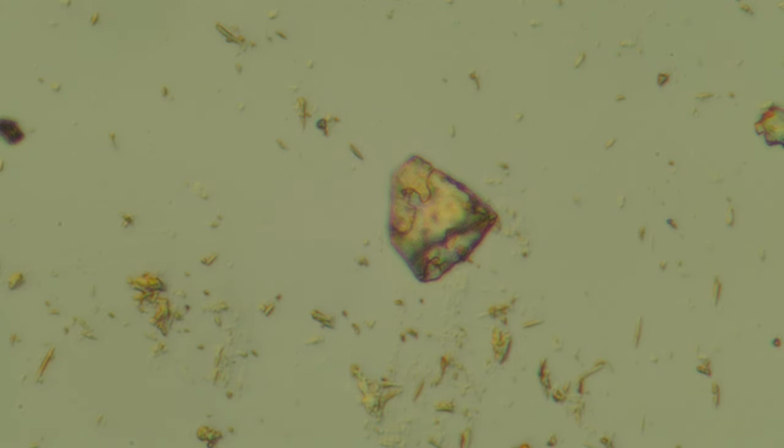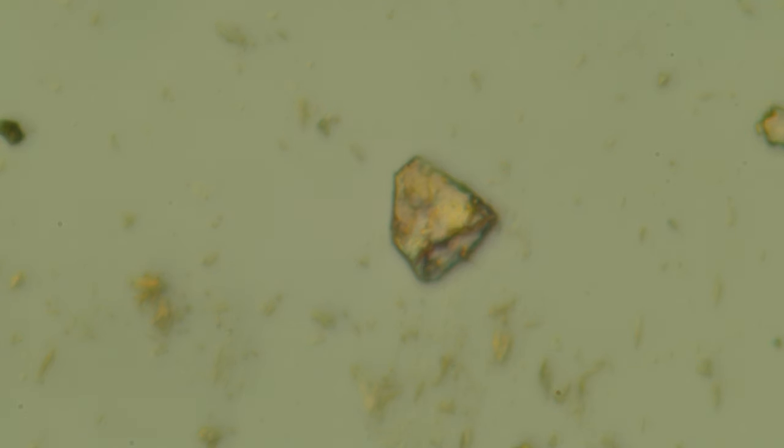So I don't know. Again, I'm not the expert, but are we getting a lot of chromatic aberration here? Is that why it's sort of blurry on the edges? And if I look in the microscope, in the binocular eyepieces, it's much, much smaller than on the camera. Much, much bigger field of view and so forth. And it does look quite different.